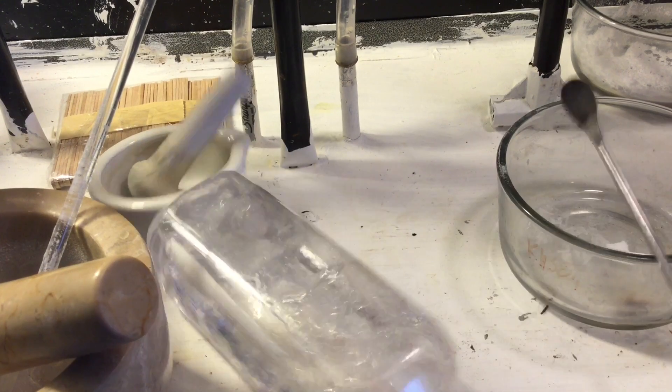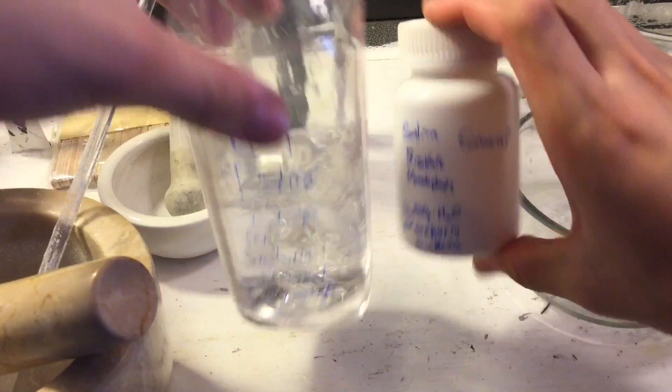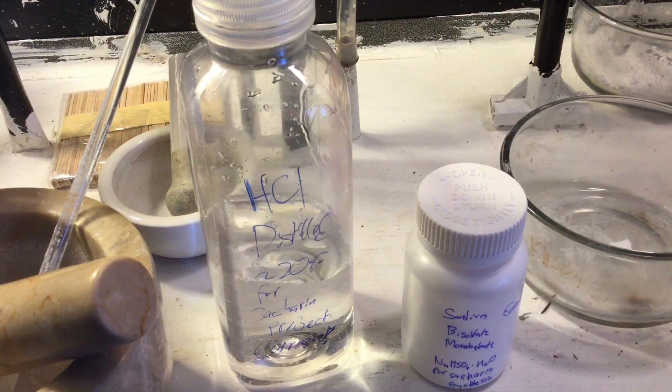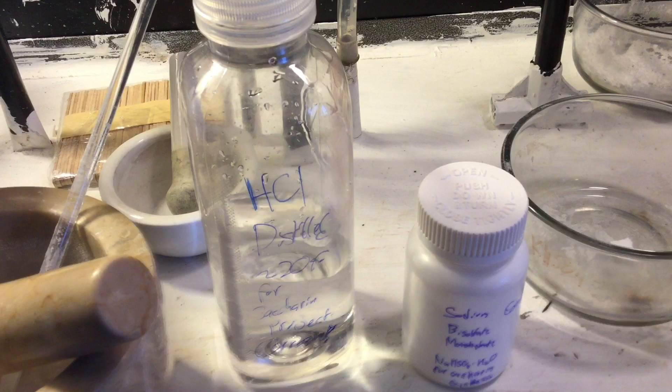Welcome back everyone. Today we're making hydrochloric acid and sodium bisulfate, which both will be used in our chlorosulfuric acid synthesis, which failed actually.